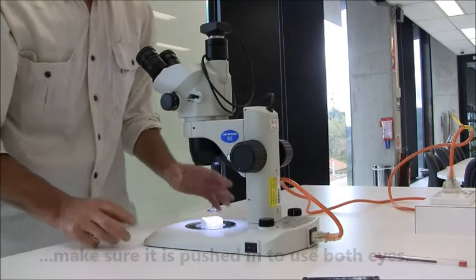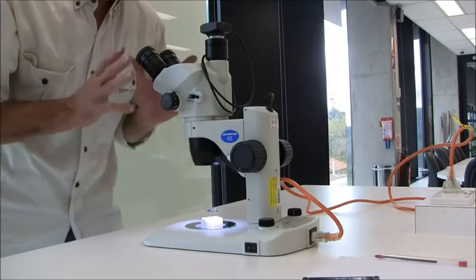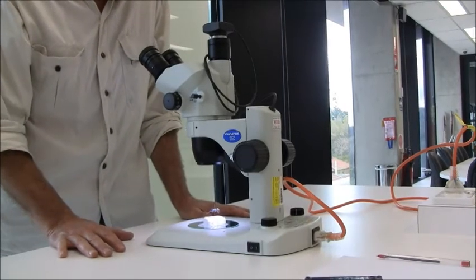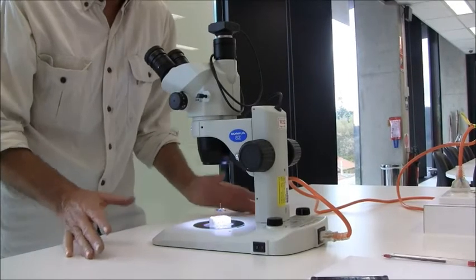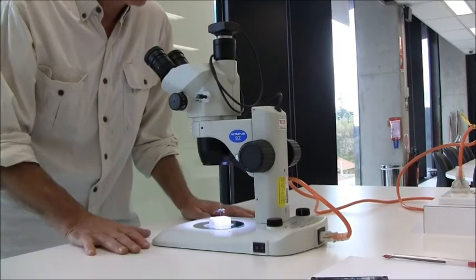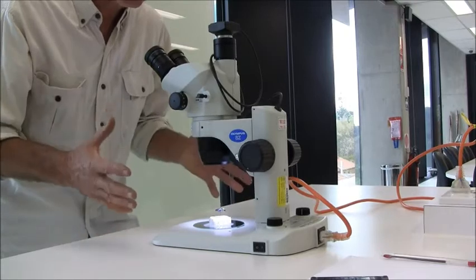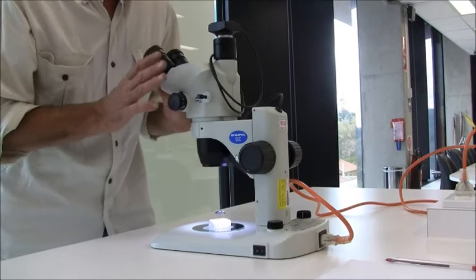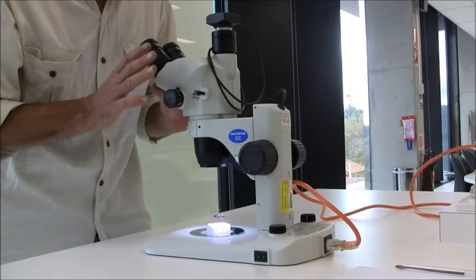Now the next thing that we have to do is because these are used with both of your eyes, you have to focus them for your eyes. Now you might have eyes that are perfectly equal, but you can't assume that the person that used this before you had equal eyes. And so this is a vital step.